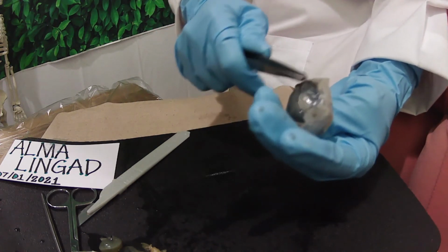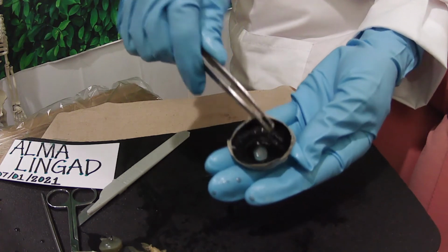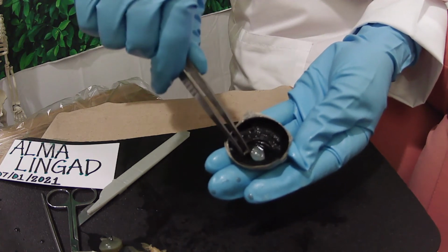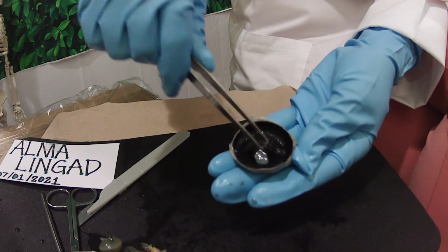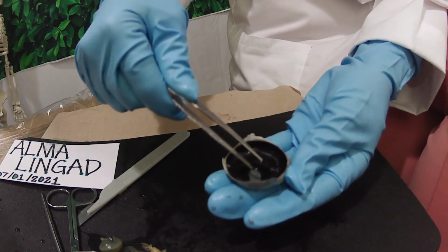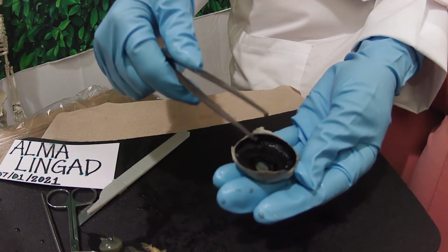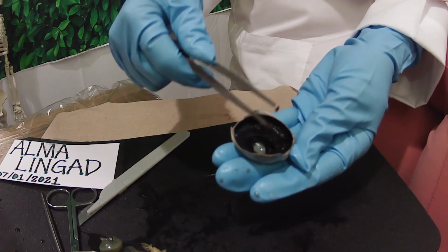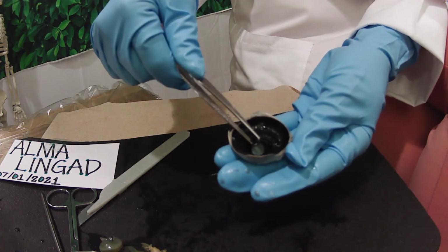Okay, so after I scoop the lens, the iris is behind the cornea. As we discussed before, the cornea is the clear outer layer of the front of the eye. So the iris behind the cornea has an adjustable circular opening in the center called the pupil. By the way, the iris provides an individual with eye color, and the pupil, which is the black center of the eye, functions to let light in and focus it on the retina, the nerve cells at the back of the eye, so we can see. Muscles located in our iris, the colored part of our eye, control the pupil.